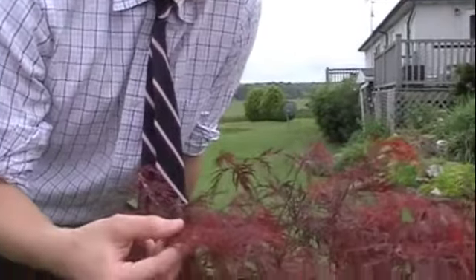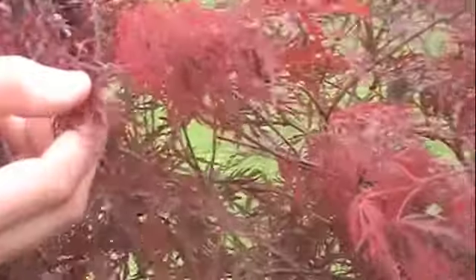But you may have heard that chlorophyll, a pigment in plants, plays a major role in photosynthesis. Now this bush here has been red all year. Does it have chlorophyll in it? I thought chlorophyll was green. What does it use for photosynthesis? In this week's lab, we will use chromatography to explore plant pigments and see if chlorophyll really is the only pigment plants need to survive.